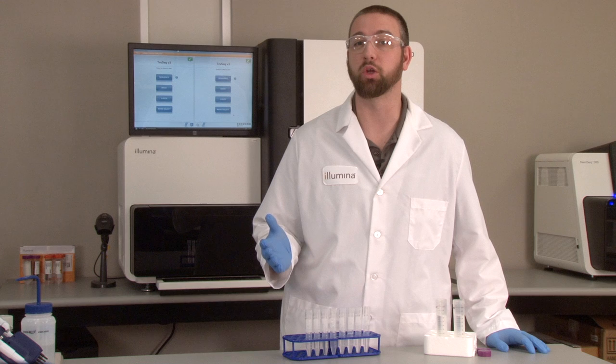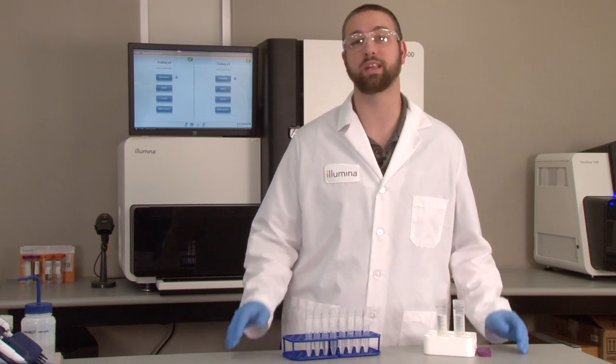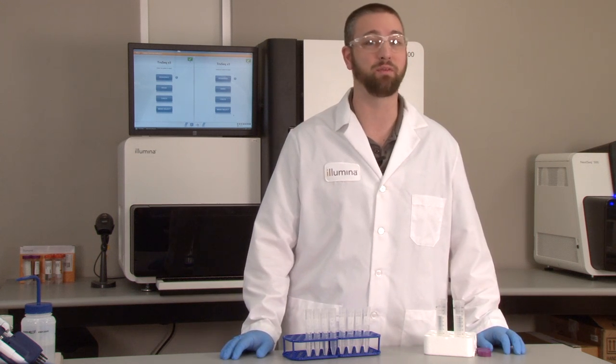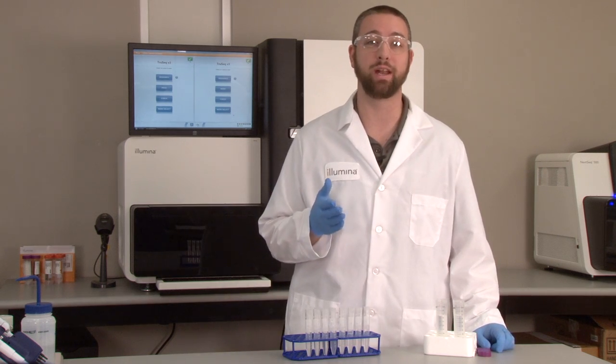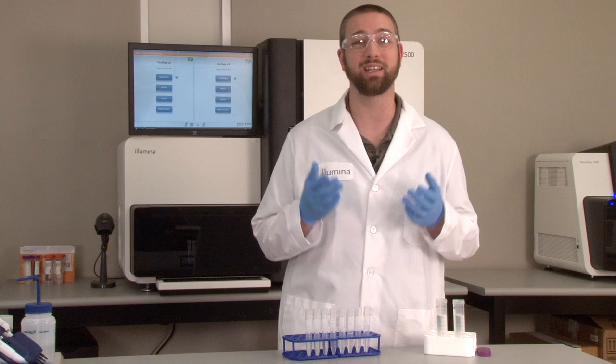Measuring the wash waste volume of individual lines can be crucial data in identifying lane specific fluidics problems or general flow issues. The actual collected waste volume should be within 10% of the expected volumes. If in doubt, contact your local service and support team or technical support.